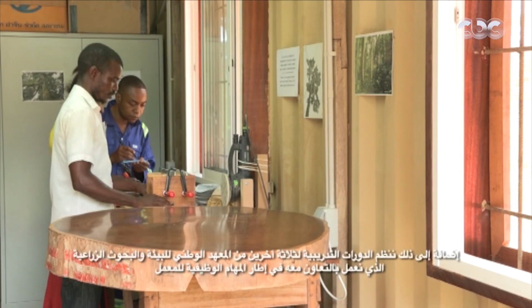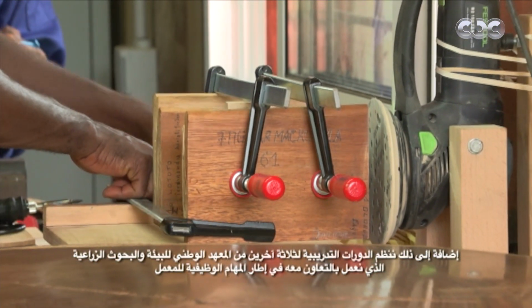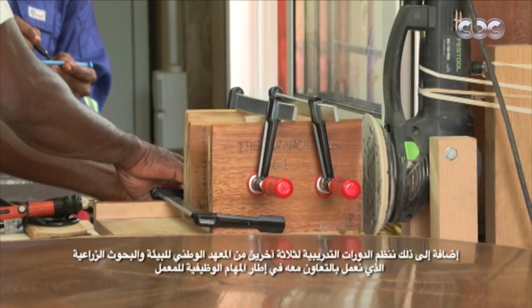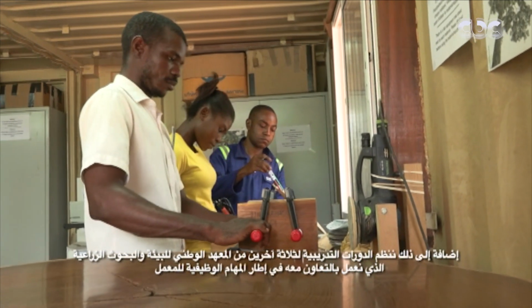We also sometimes organize trainings here within the lab. At the moment, for example, we are training 3 people from the local INERA research institute to become assistants in the lab. So we are working together with INERA as well. We are integrating INERA agents within the functioning of the lab.